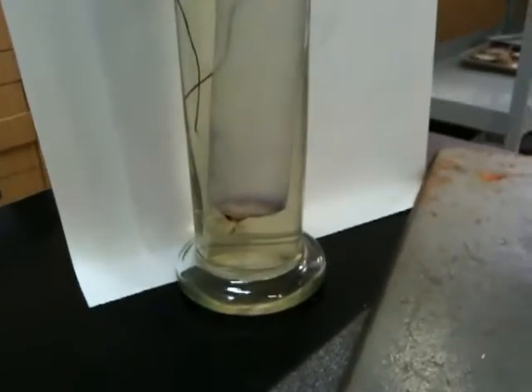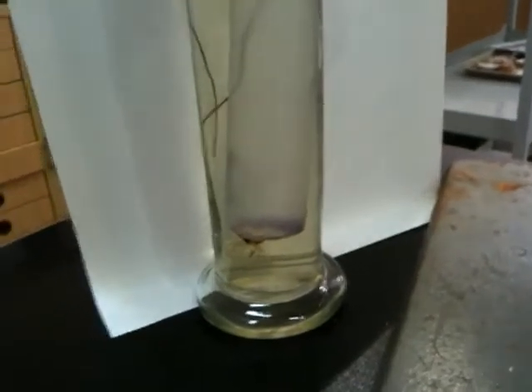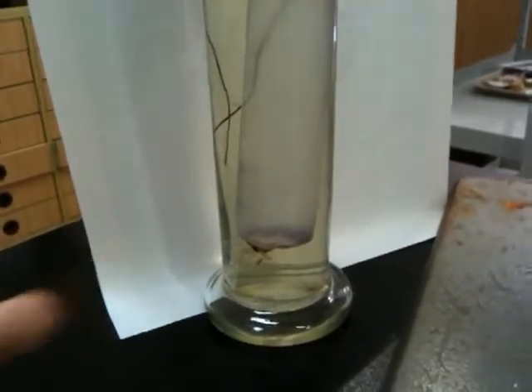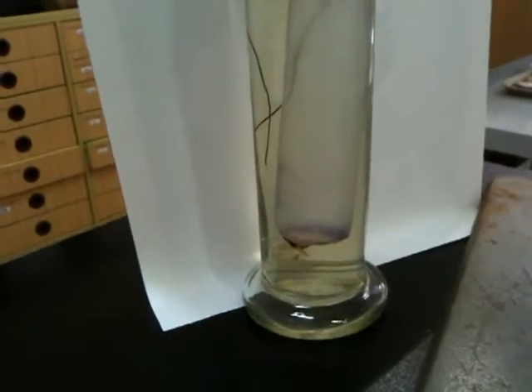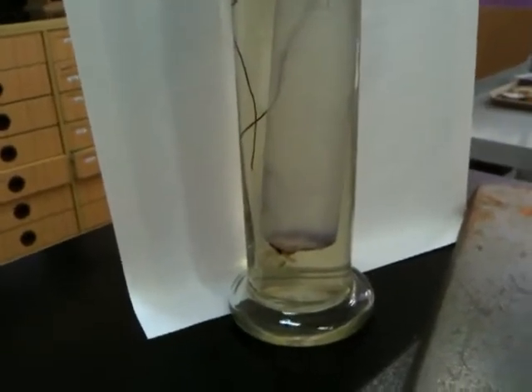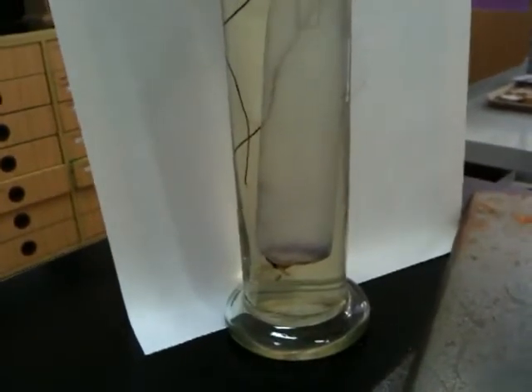Okay, so it's been half an hour and we've seen something happen. What's happened, girls? The colour inside the bag has started to change down the bottom. It's turned a bluey black colour. Excellent. What does that mean? It means that the potassium iodide from the mixture on the outside has gone through the bag. Great.